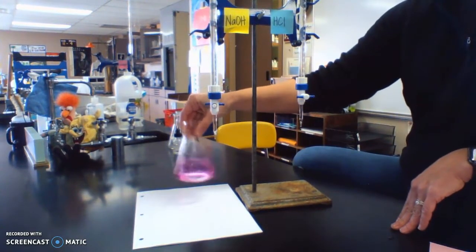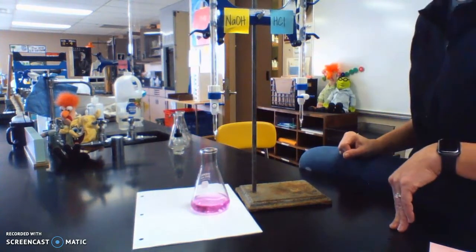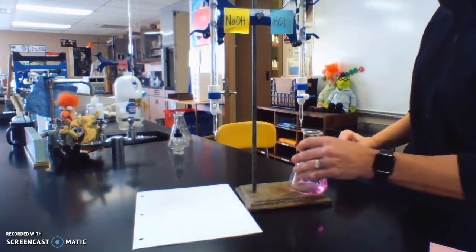And this is why I didn't record my HCl. All right, so we went a little too far. That's a little too pink. So I'm going to add a few drops of acid here.